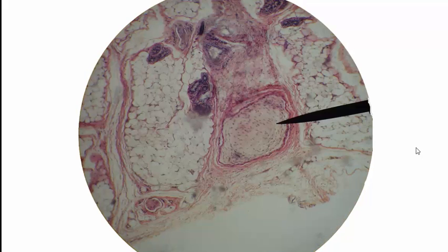Moving to the next slide, this is another Pacinian corpuscle, or lamellar corpuscle, but the way the section of tissue turned out, it doesn't really show the layers well, and you don't see the center of the receptor, so it's a pretty ugly image of a Pacinian corpuscle, but that's still what it is. And then also we see sweat gland, sweat gland, sweat gland, and another sweat gland. And of course the adipose tissue that we see down here in this lowest layer, the hypodermis or subcutaneous.